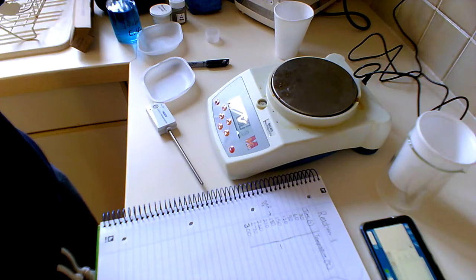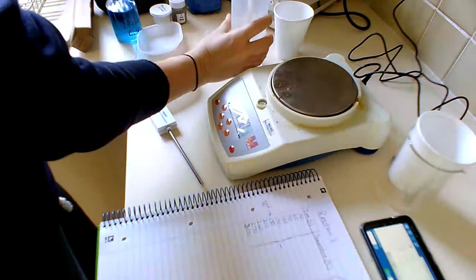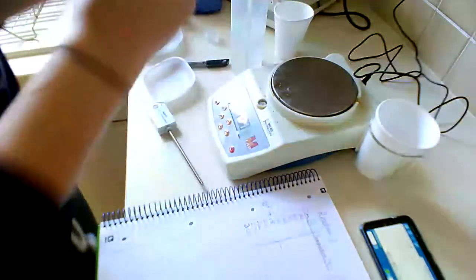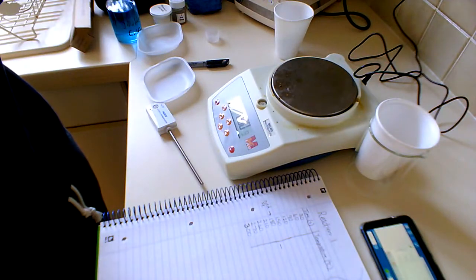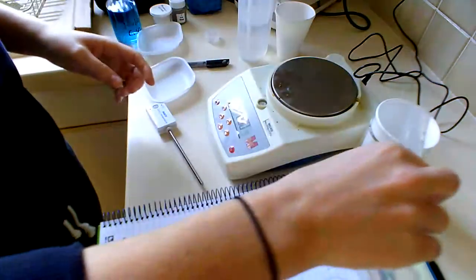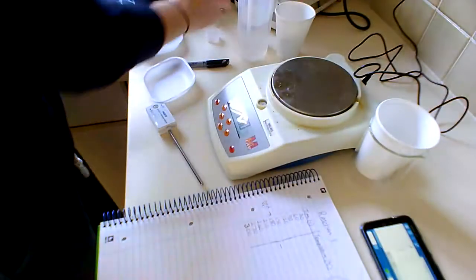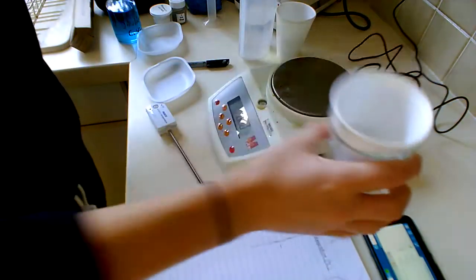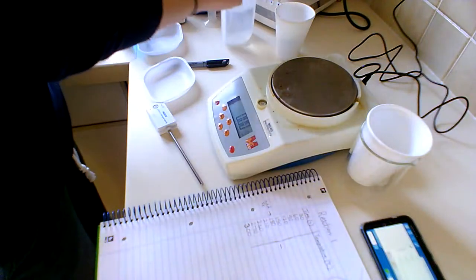I'm going to just use a measuring cylinder so that we can discuss sources of error in a later lesson. So that was 25. I only brought a 25 centimetre cubed measuring cylinder home with me, because as you've probably realised, this is not at school. I have gained permission from the relevant people to bring all of this equipment home with me. So I have my 50 centimetres cubed of water in my polystyrene cup in my beaker.